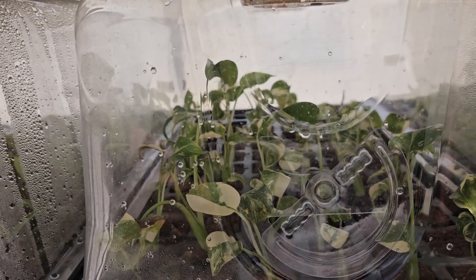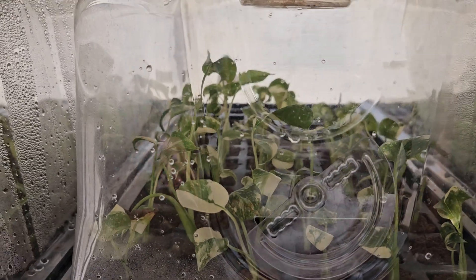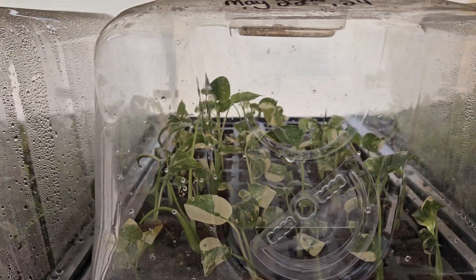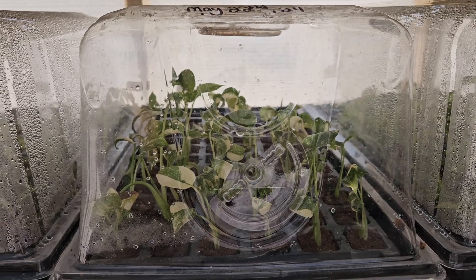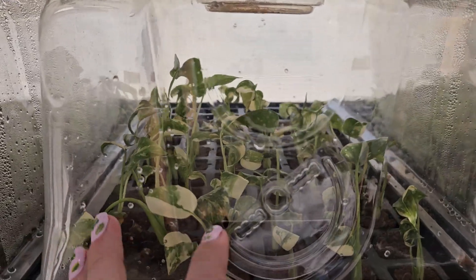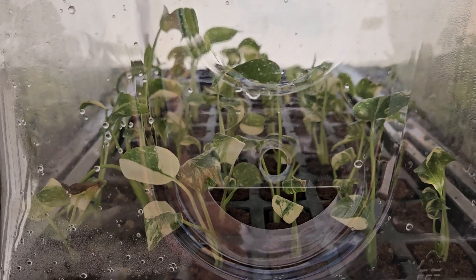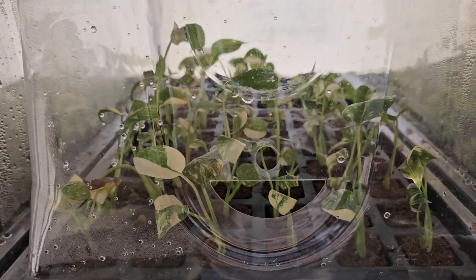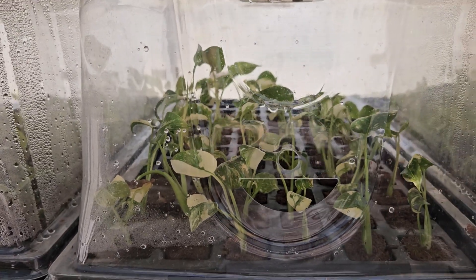You can take a few and poke one hole. Your next step you'll want to do two, three, and then you can reuse them for each leg of your journey. These tissue cultures are getting ready to be out full-time. I would say about another week of us continuing to make this hole just a little bit bigger, or take it off completely like I just did — and that's how you're going to slowly introduce ambient air and light into your cultures.